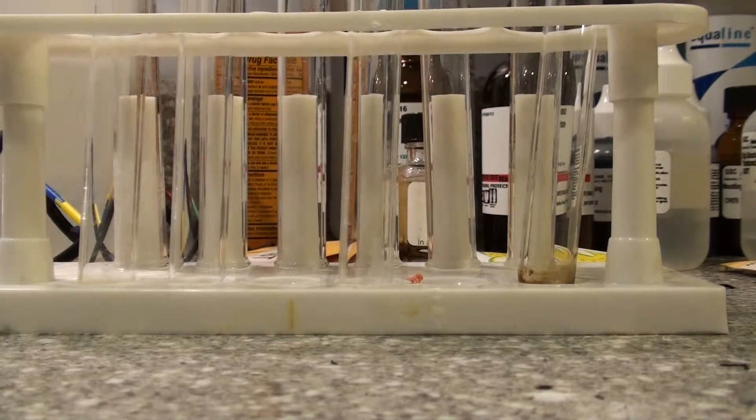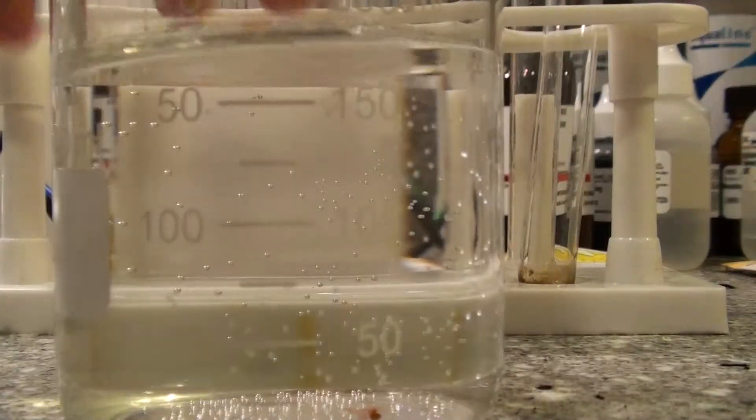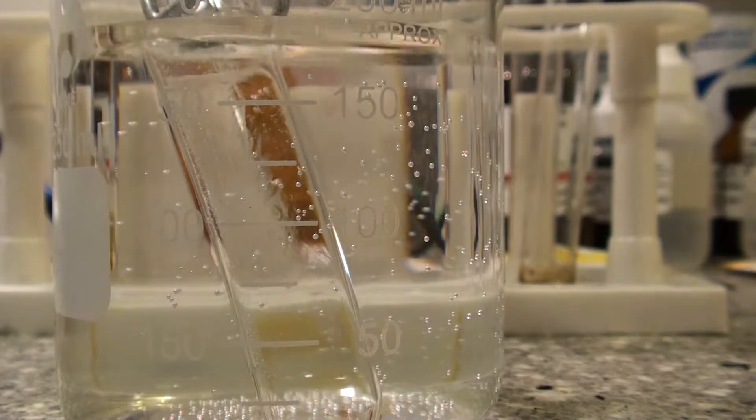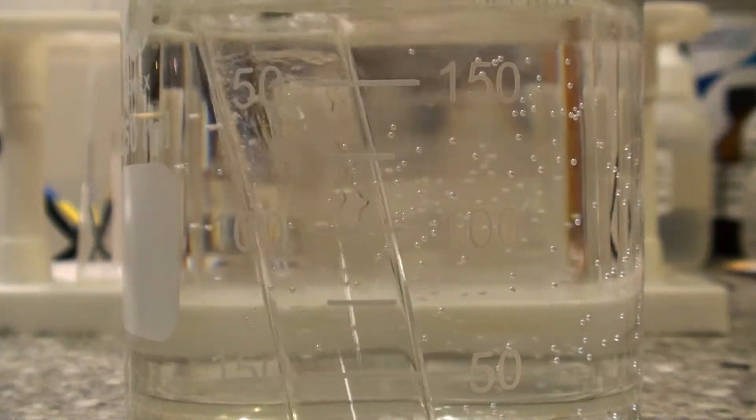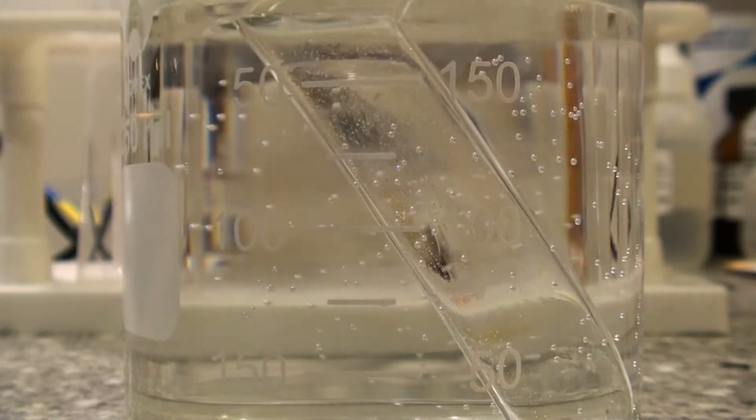So, I'm just done melting it. Here, I'm done. Now, I want to place it in water. This just speeds the cooling up of the chemical. But, if I were not to put it in water, it would take a bit longer.